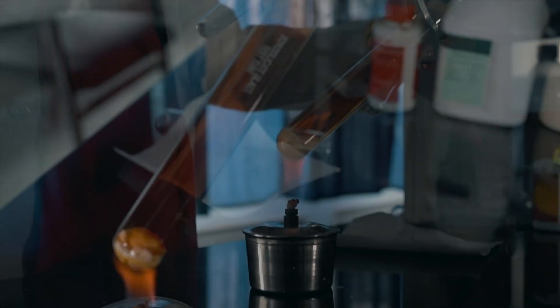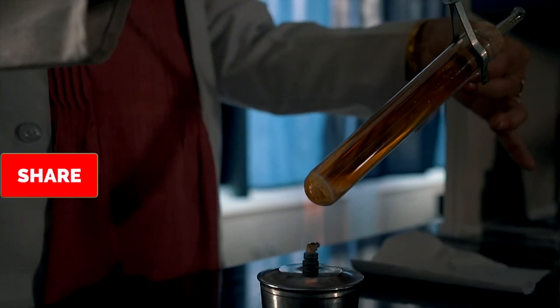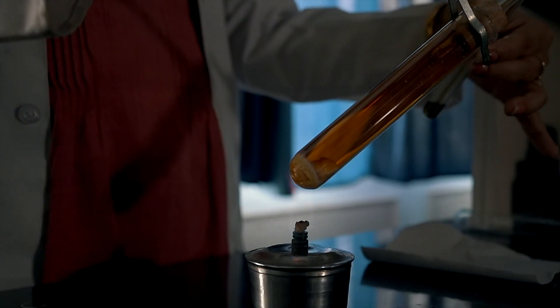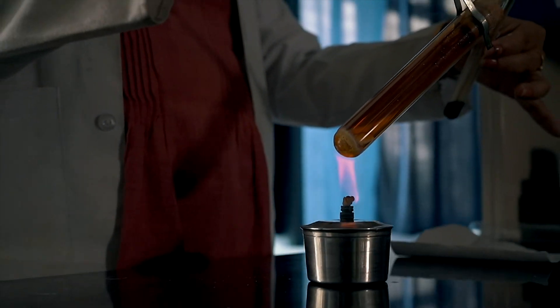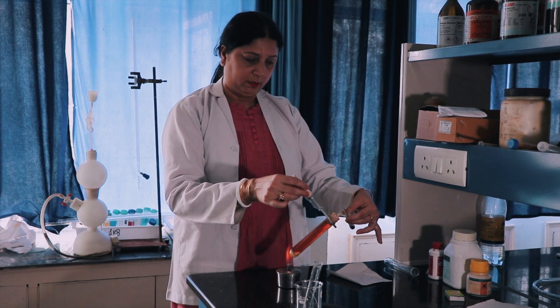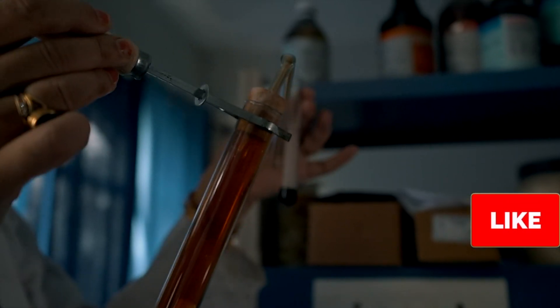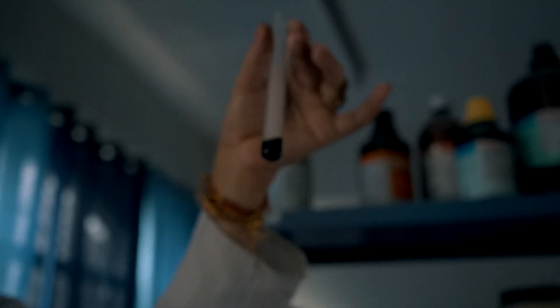Can you see the brown fumes? These fumes are of nitrogen dioxide gas. Now I am passing the brown colored gas NO₂ through a test tube containing acidified ferrous sulfate solution. When we pass nitrogen dioxide gas through acidified ferrous sulfate solution, the solution turns black. This black color confirmed the presence of nitrogen dioxide gas. NO₂ is confirmed by passing through acidified ferrous sulfate solution.